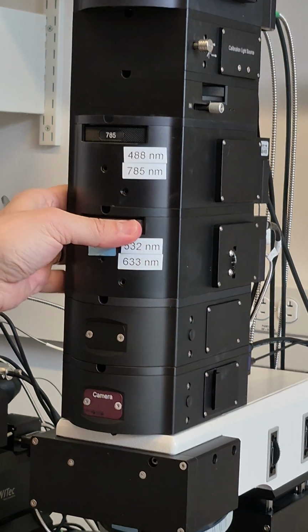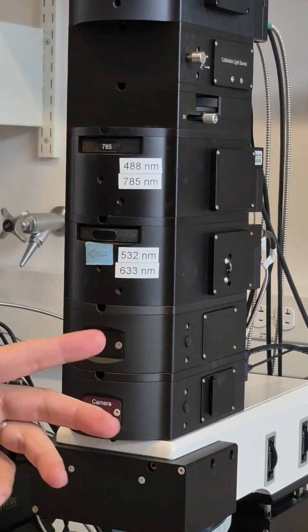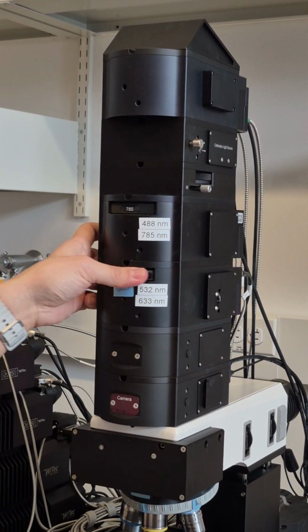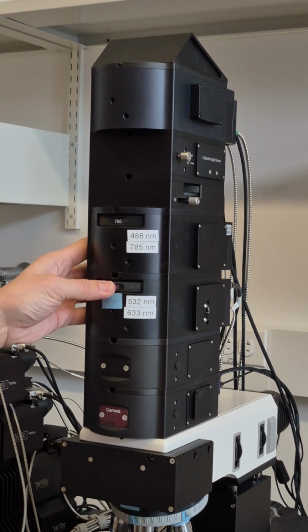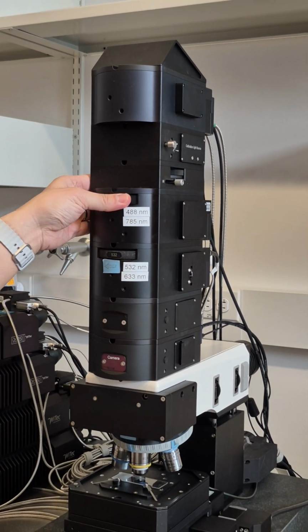And this one should be empty. You must rotate until you see the empty. Right. Okay. So today we will use 532. So we rotate, rotate, rotate. This is the direction you should rotate. You can move both directions, but we suggest that you just move this way. Okay, 532, and this one should be empty.